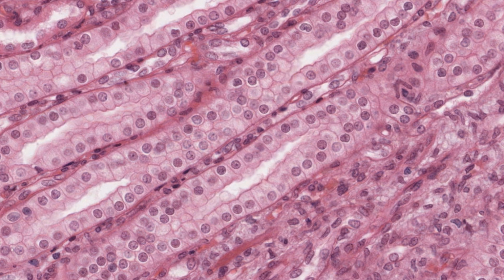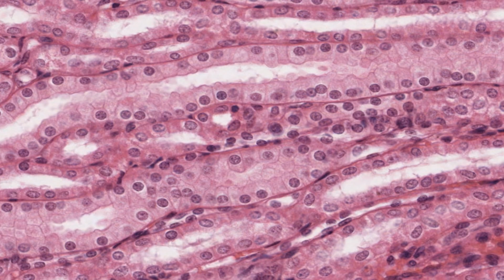Most of the epithelial cells are cuboidal in shape. Look at these cells here and note their rounded nuclei. They form these long tubules. Occasionally you'll notice, such as here and over here, that some epithelia are halfway between squamous and cuboidal, and so they can be called either tall squamous or perhaps low cuboidal.